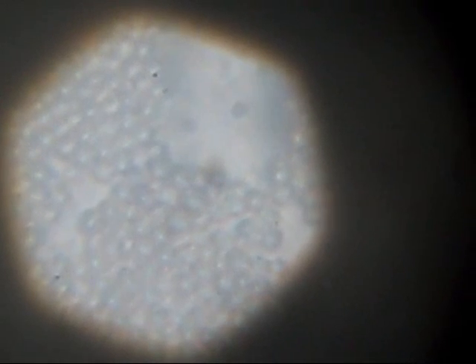I don't know why they do that, but you can see more cells moving and stuff there. That's either mass division or a great flow of current, which we'll see again later.